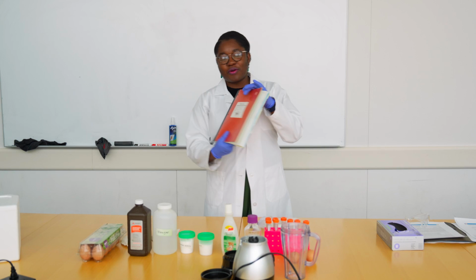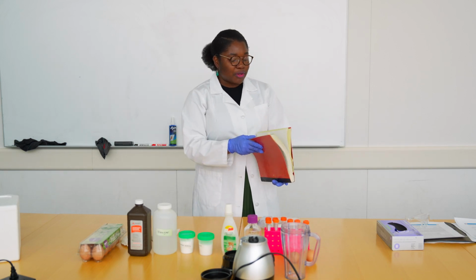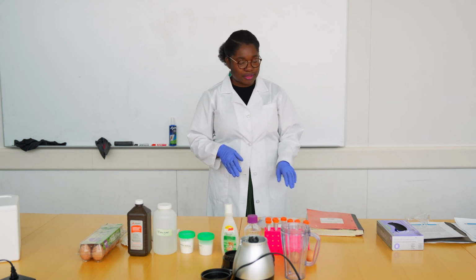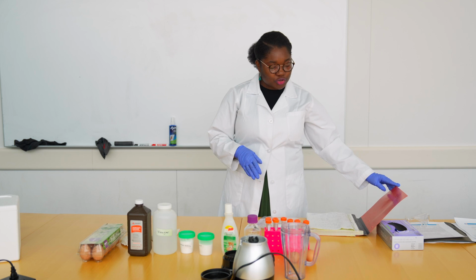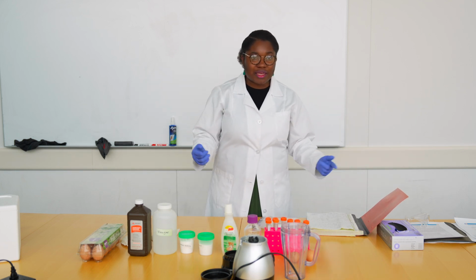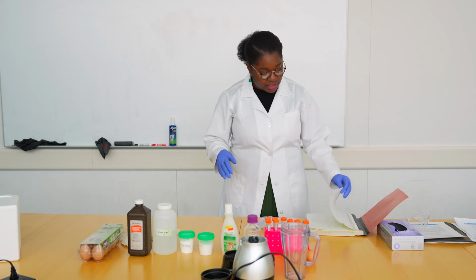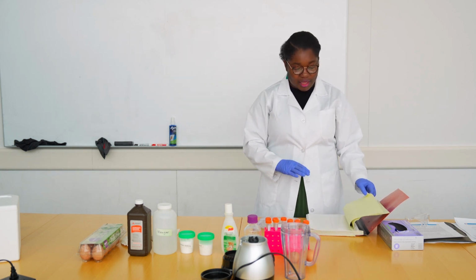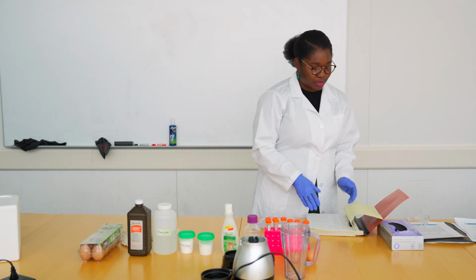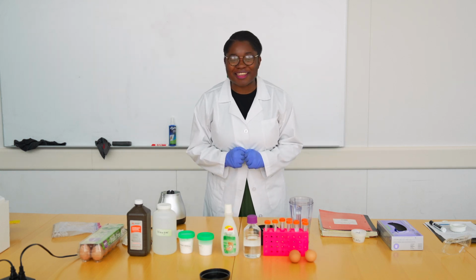And let's go. We have also a lab notebook. And I would encourage you to record everything that you are doing in this experiment, because that is going to help you keep track of what you're doing, why you're doing it, when you're doing it, what did you change, and also what were the results of it. So make sure you write everything from your protocol to your findings in your lab notebook. Now that we know about the materials that we need, we can start the experiment.